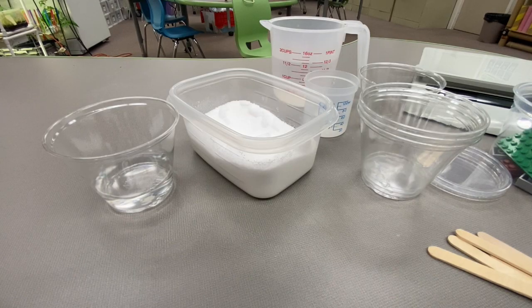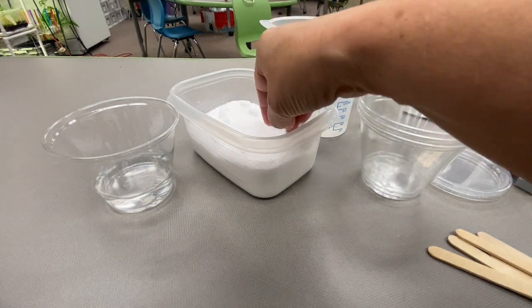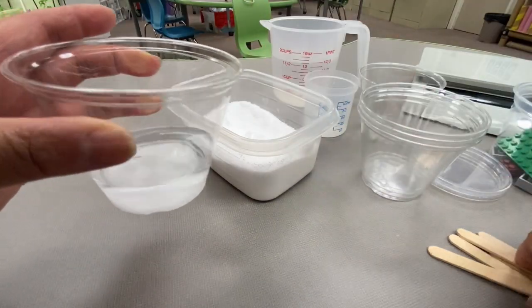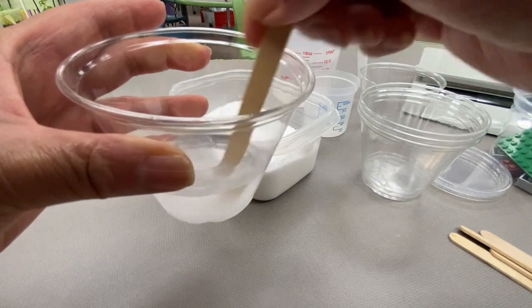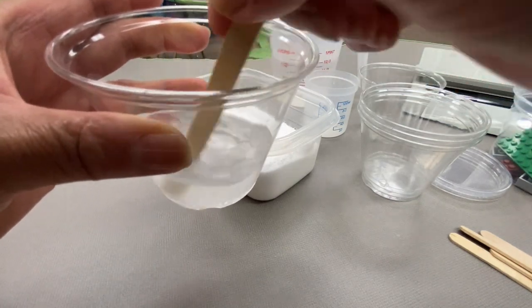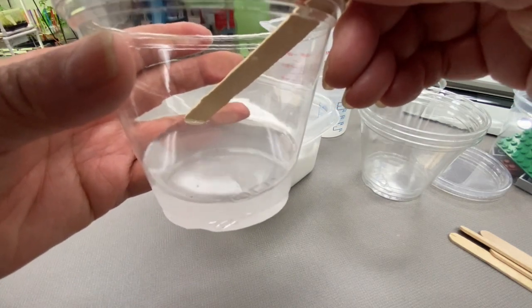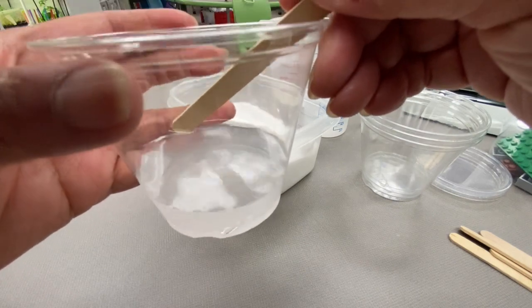Today we will be investigating salt solutions. Where does the solid material go when a solution is made? So when I mix this salt into this water, where does the salt go? When the salt dissolves, does it go away? How can we prove or disprove this?